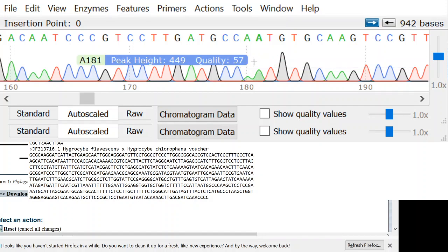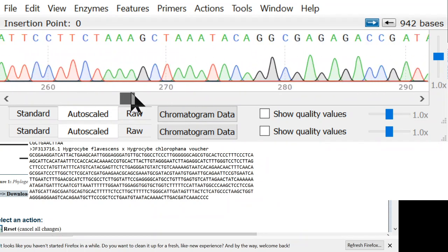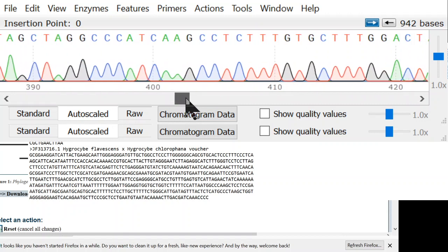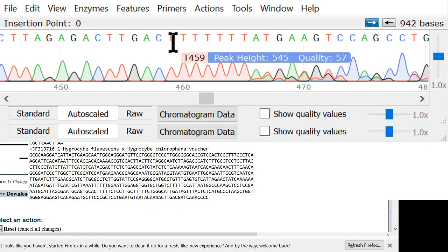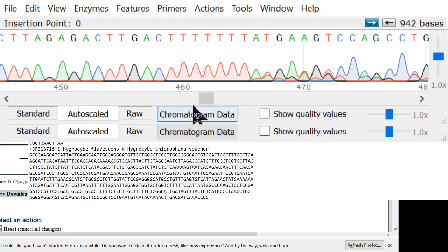We have all these nice good peaks. They're all sharp. There's no weird background signal. You never get two things in the same place. So just going through here, this looks really good. And then all of a sudden we start to see data that does not look good. What happened here is we have a whole bunch of T's in a row. We have 8 T's in a row. And what that does is it causes enzyme slippage, and enzyme slippage causes an off-by-1 error in the sequence.